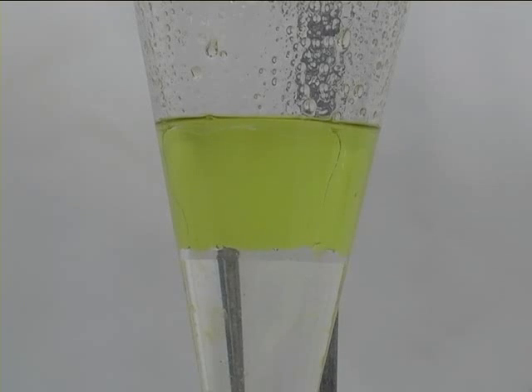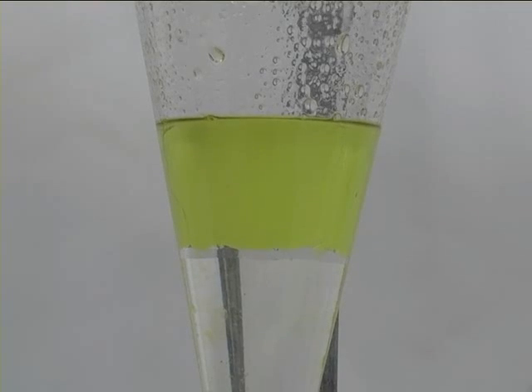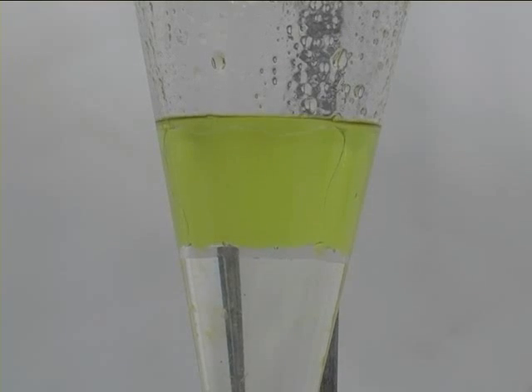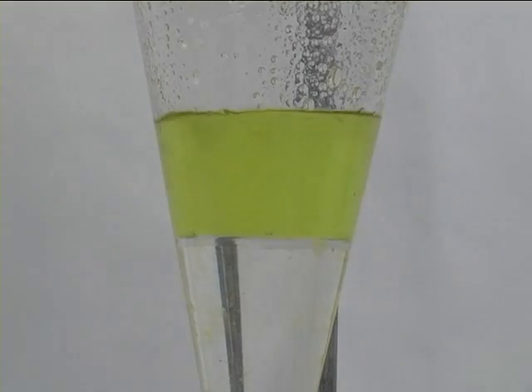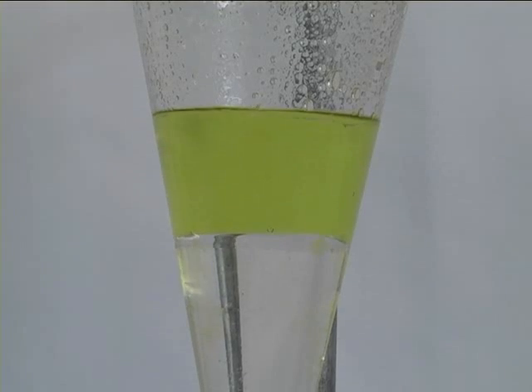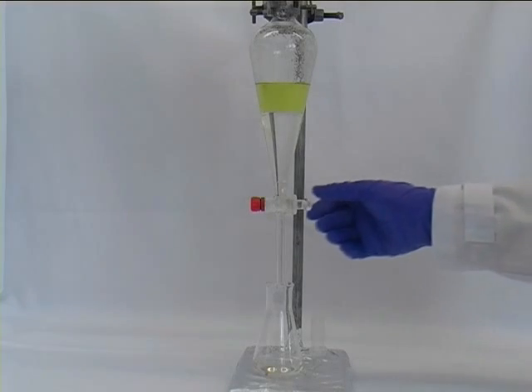A simple way to test it is to add a little bit of the aqueous phase at the top and watch whether it is running through the top layer or whether it's being collected in the top layer. As you could see in this example it was running through, so the aqueous phase in this example was the bottom layer.